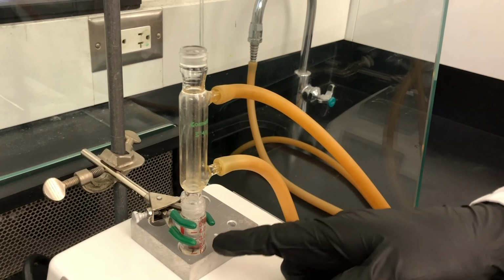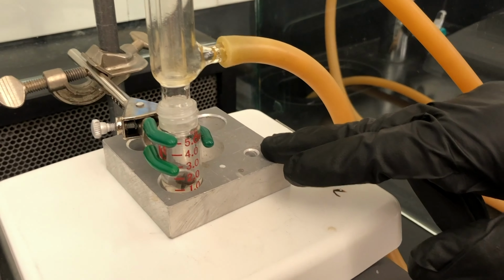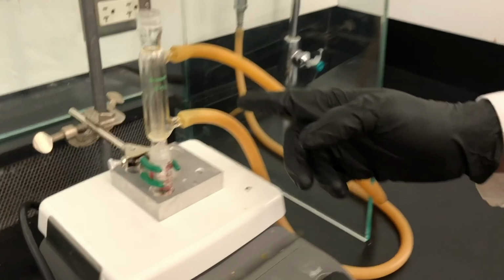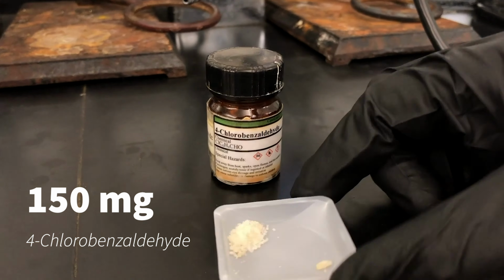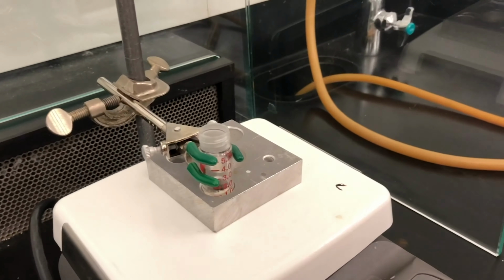Here we have a 5 milliliter conical vial and a large spin vane. We have an aluminum heating block to heat it up evenly, and this is fitted with a water condenser, water coming in here, and water coming out here. We have weighed out 150 milligrams of 4-chlorobenzaldehyde. We remove the water condenser and place the 4-chlorobenzaldehyde into the conical vial.